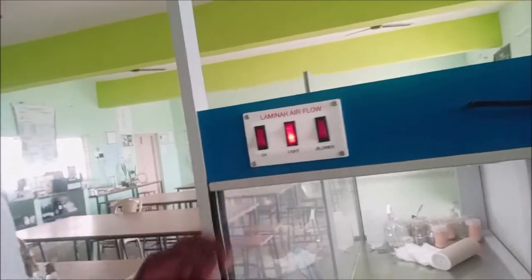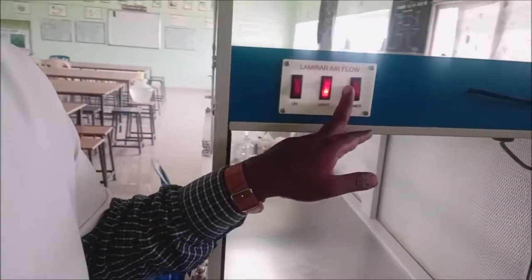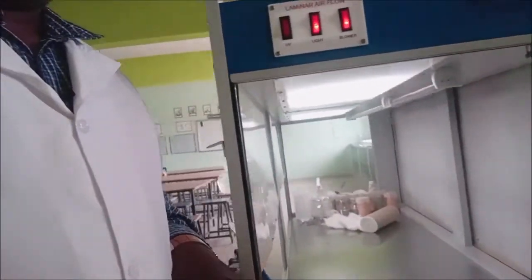Before starting work, switch on the light, then open the working door. Once the working door is open, switch on the blower. When the working door is closed with the blower on, air circulation will occur and flow back inside the chamber.